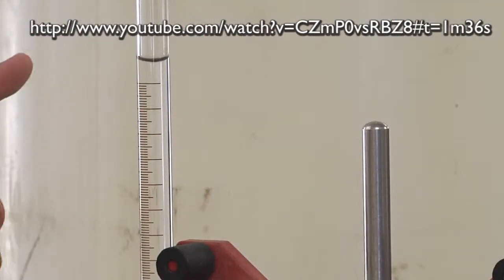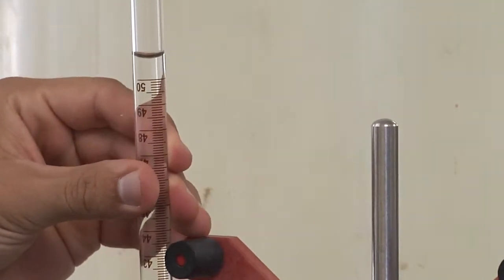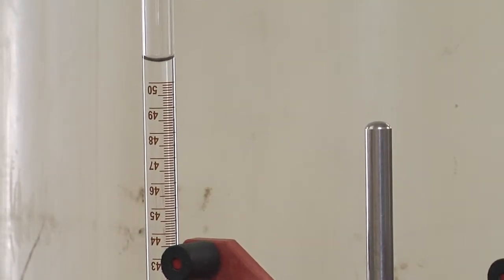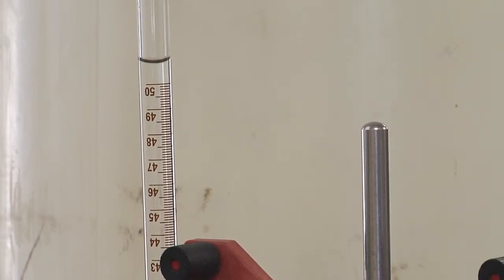Remember, we want to measure how far our water level drops. If you can't read the marks, it's not useful. Therefore, you should empty down your liquid level until it's at least at the 50 mL mark.